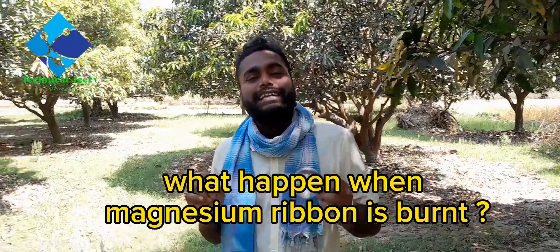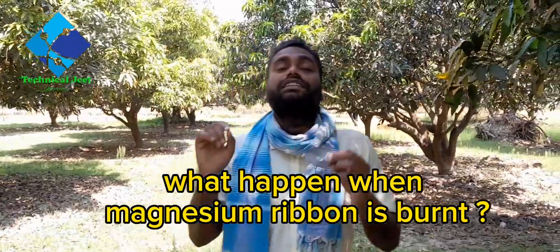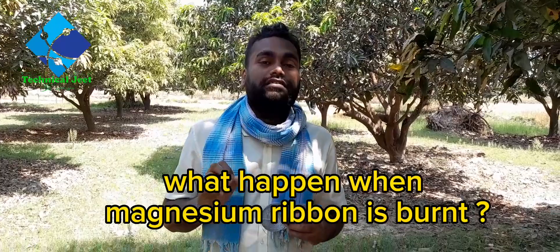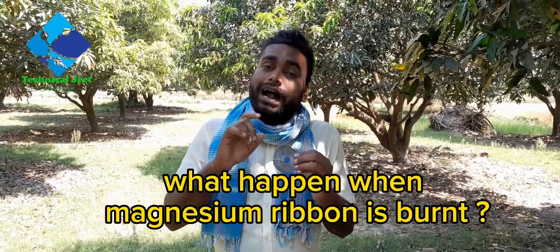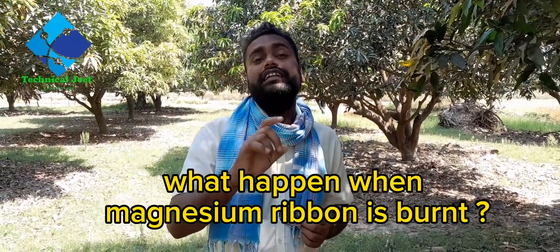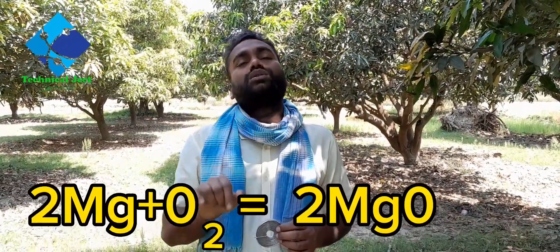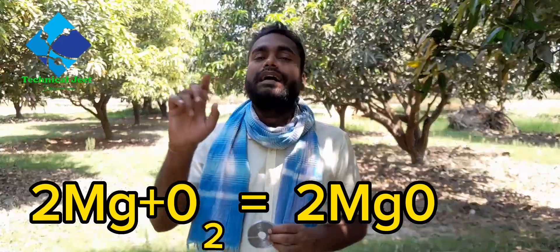What happens when magnesium ribbon is burned with air or oxygen? When magnesium ribbon is burned in the presence of oxygen, Mg plus O2 gives MgO, magnesium oxide. We have a live experiment.